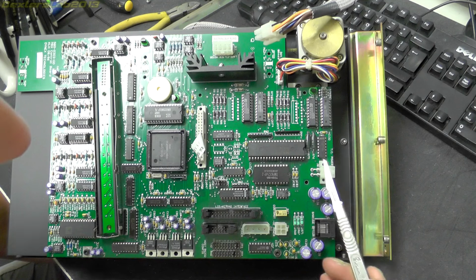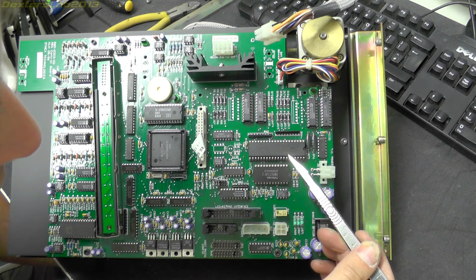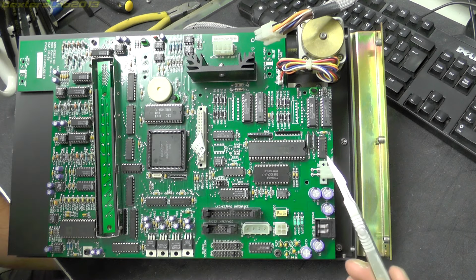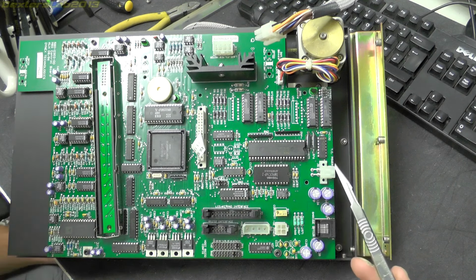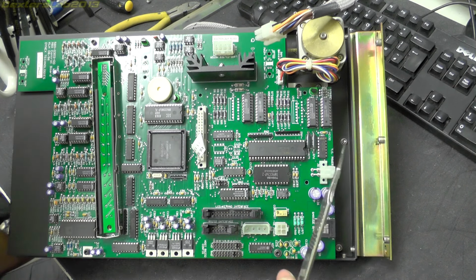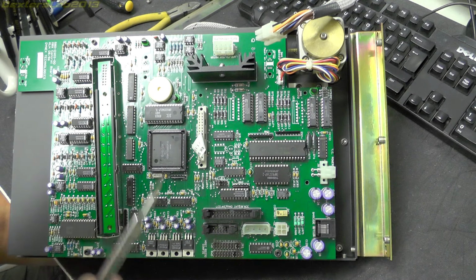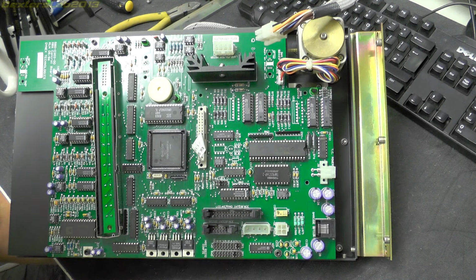And next to that we have an NEC D71055C-10, and that comes back as a low power CMOS programmable interface unit for use in microcomputer systems, typically 3 I/O ports to interface peripheral devices to the system bus. So we've got 3 8-bit I/O ports, and the date codes on everything come to around about 1997. So that correlates with the filters that we saw on the filter wheel. So yeah, mid to late 90s on this one.